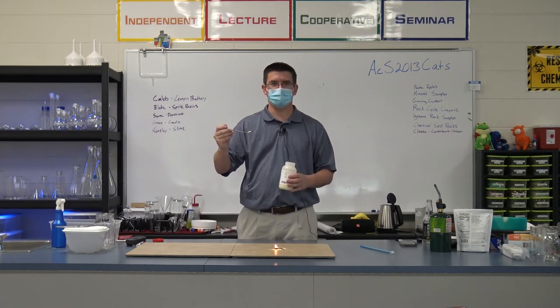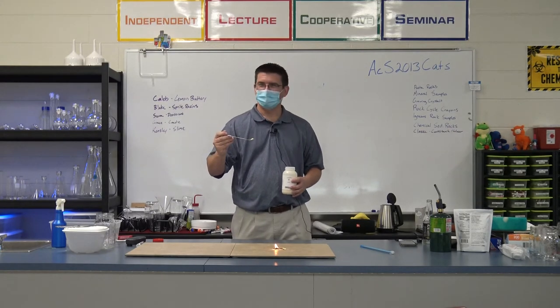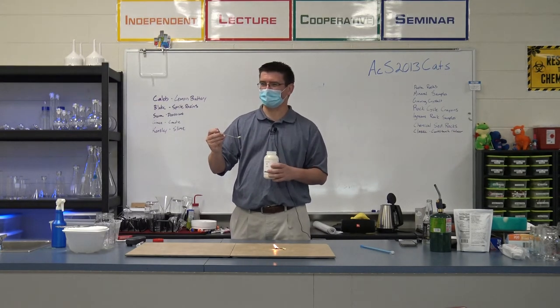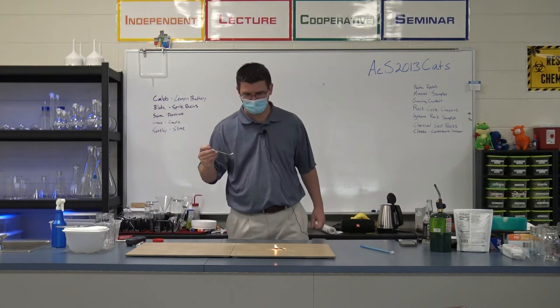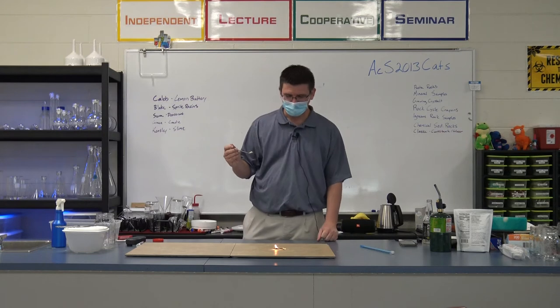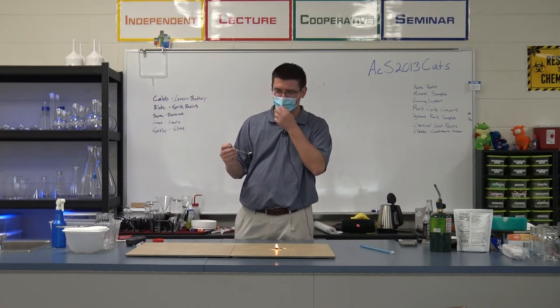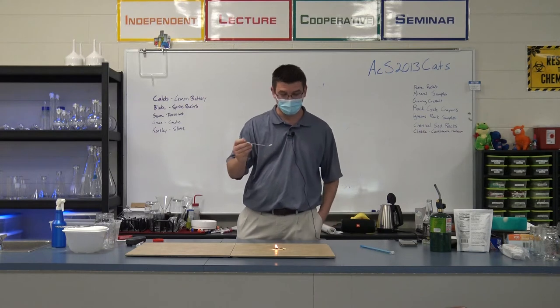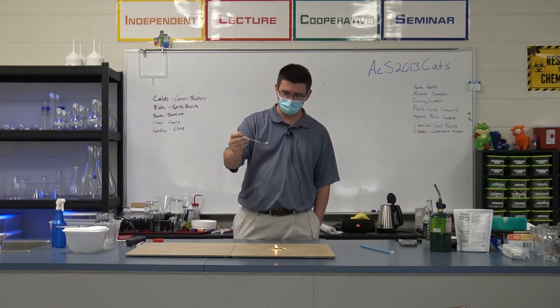It is. So would you expect it to burn the same if I add more? Maybe. One of you says no, and that's probably because if it was the same thing, he wouldn't be showing us, right? That's good scientific observation right there. Usually when I ask something like that, there's a reason I ask it, and it's not because it's going to do the same thing. So let's sprinkle a little of this on. Just watch what happens. See if you see any difference in the fire.